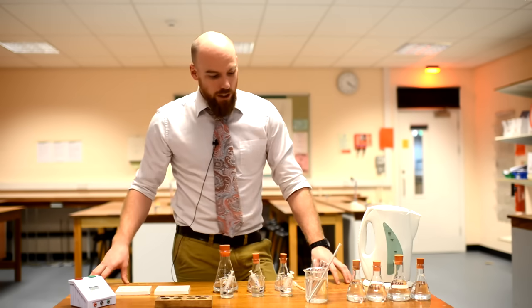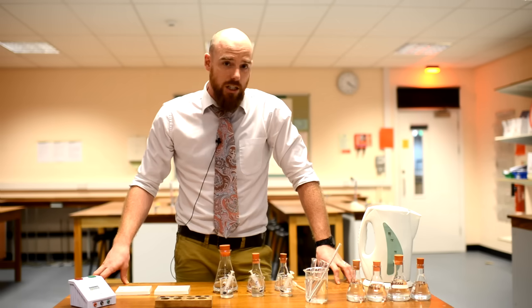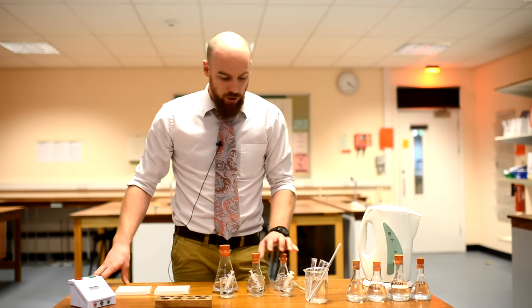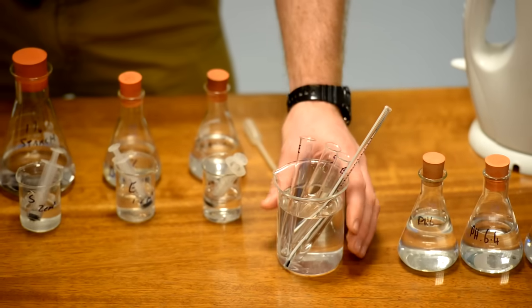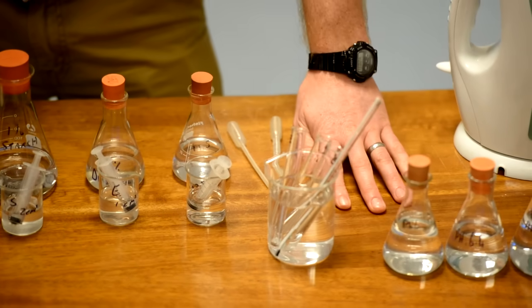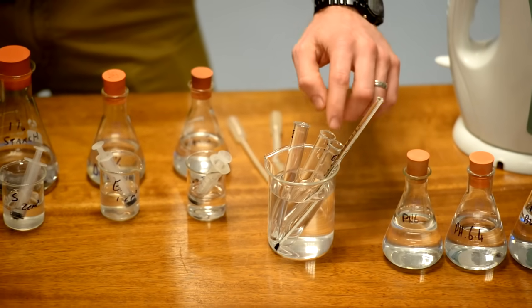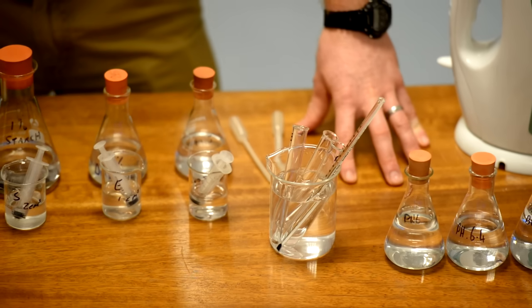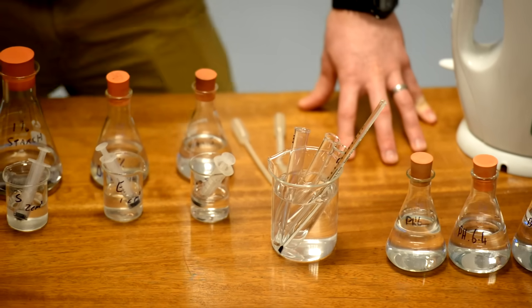To do this you'll need to control the temperature conditions that the enzyme, buffer solution and starch solution are at. I'm using a water bath here to do that with a thermometer and a test tube containing the correct volumes of each solution.